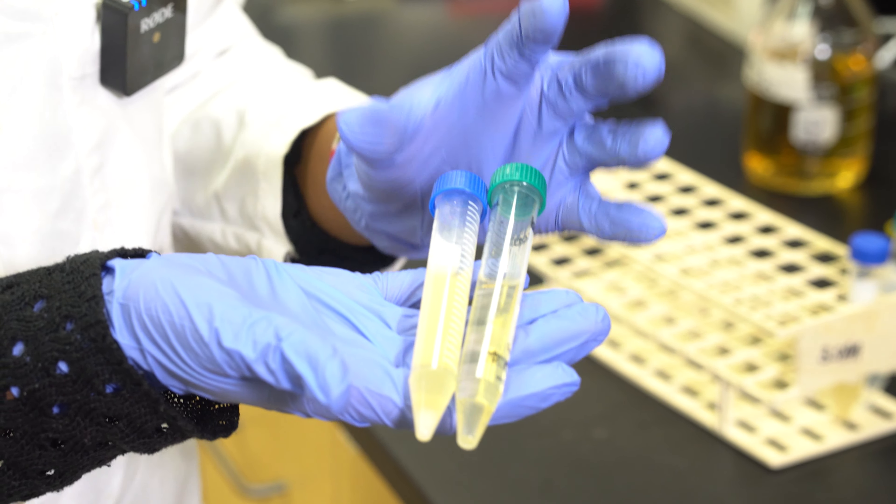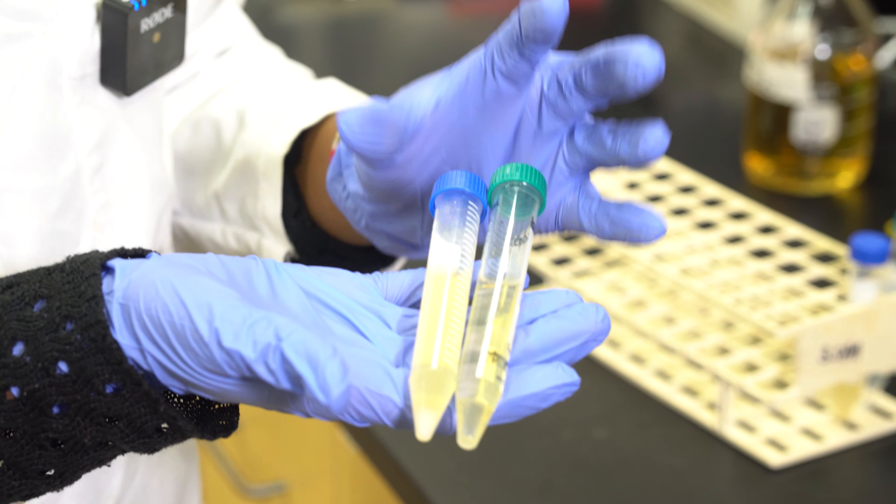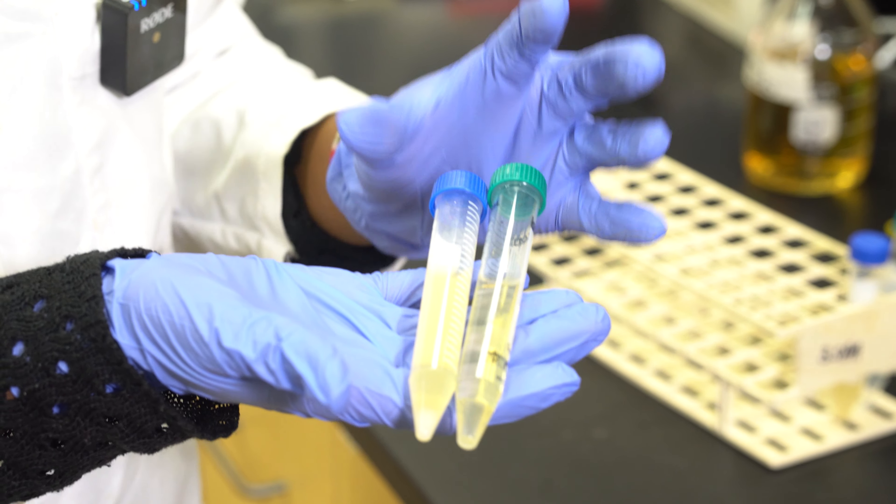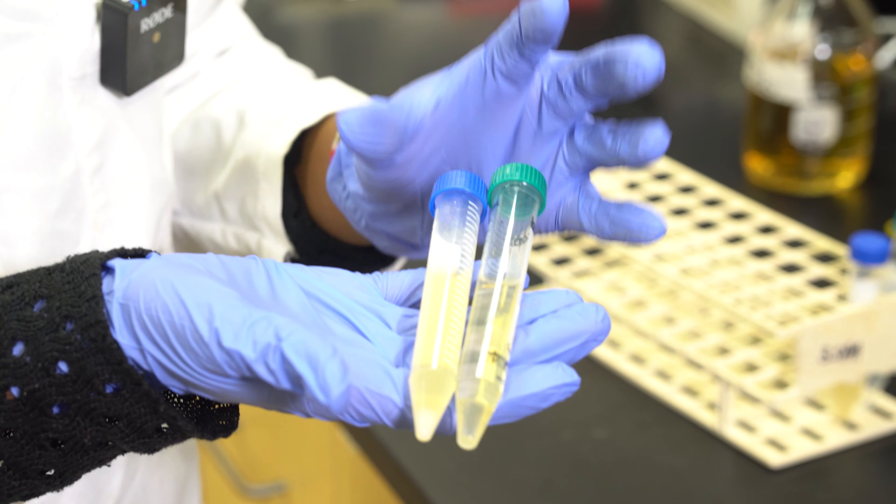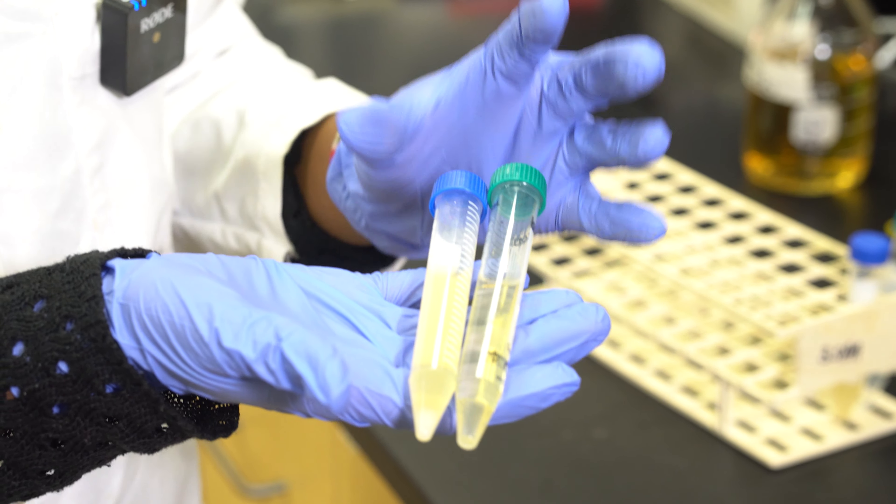Once you're finished, you're going to screw the top back onto the microorganism, followed by the tube that you just transferred the microorganism to.